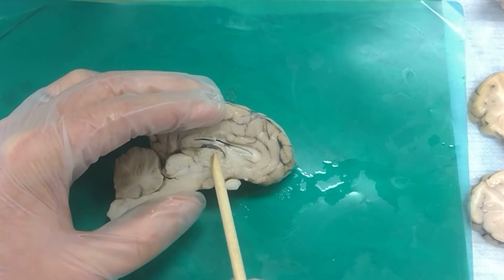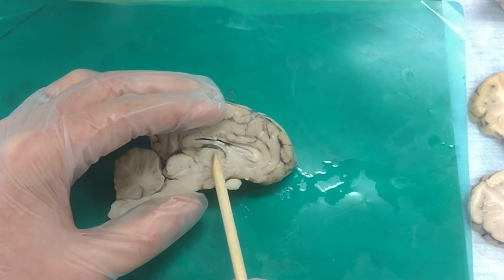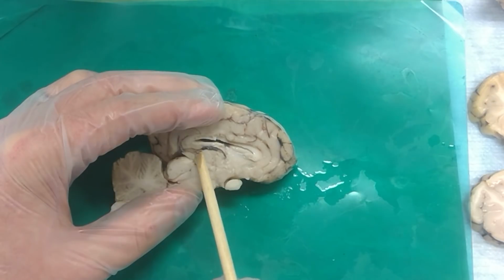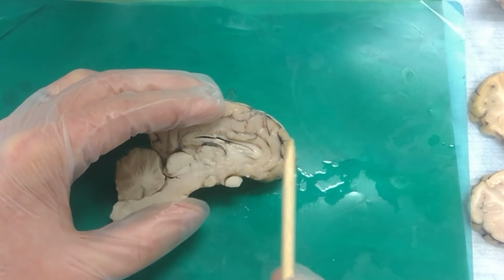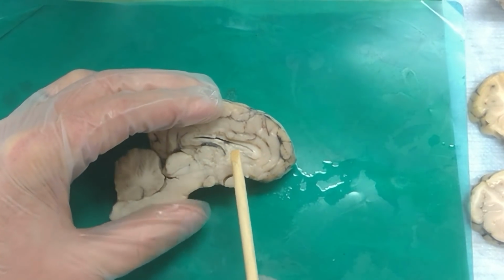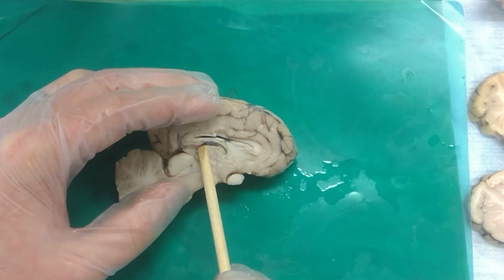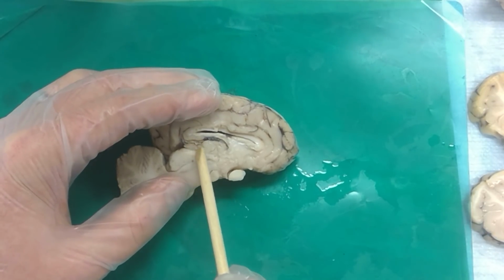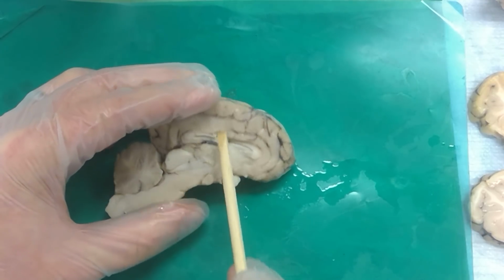Thalamus. And if we had a pin through the center of the thalamus asking about the fibers connecting both sides? Massa intermedia. And then there's this little wart, like this little bump on the back of the thalamus right here? Habenula. The what? Habenula. And then just caudal to the thalamus, there's a gland or a body. Pineal gland. There we go.